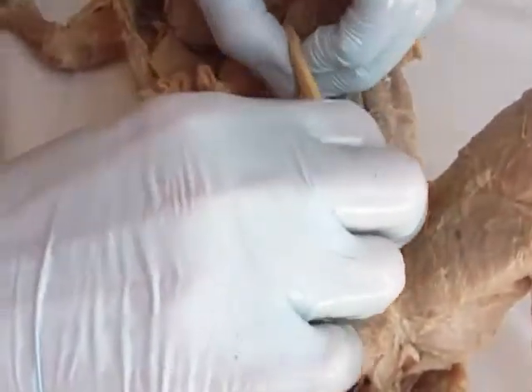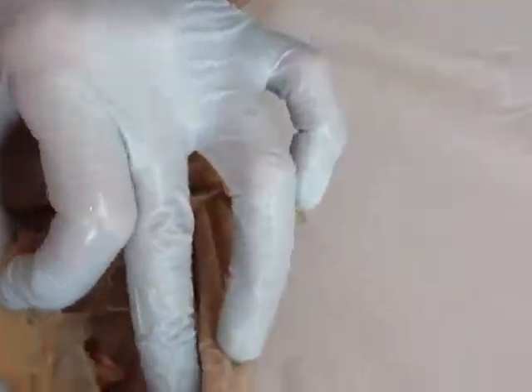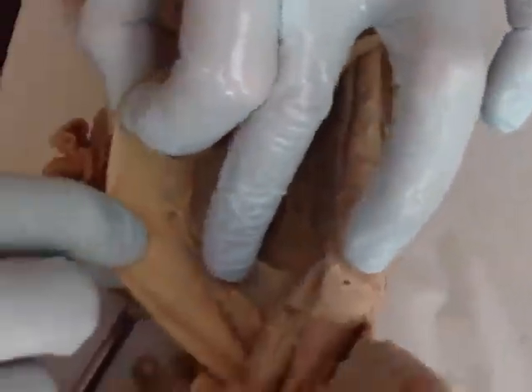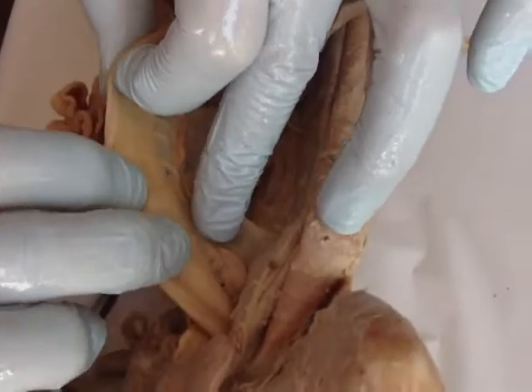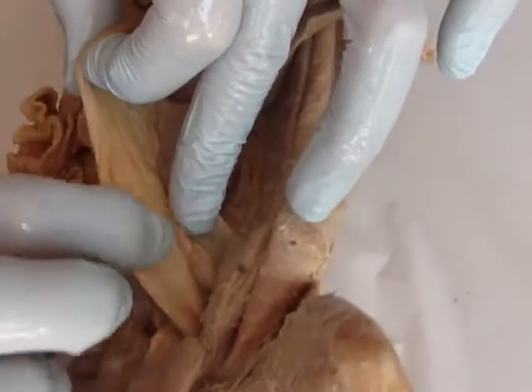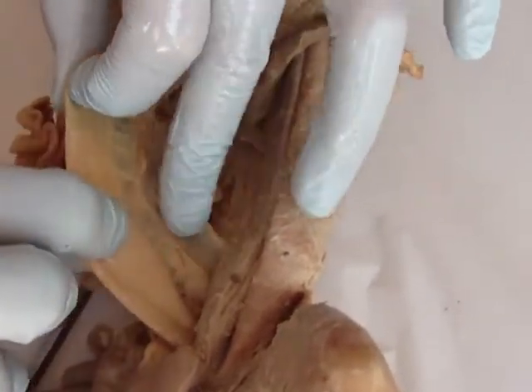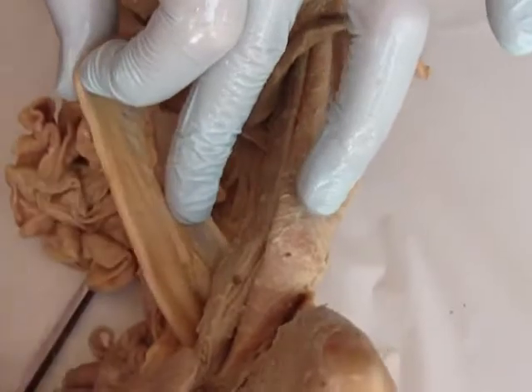When you pick up your descending colon, this is held down by your mesentery — I'm sorry — mesocolon. The large intestine is held down by the mesocolon.